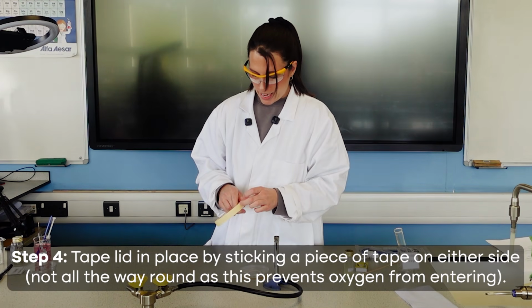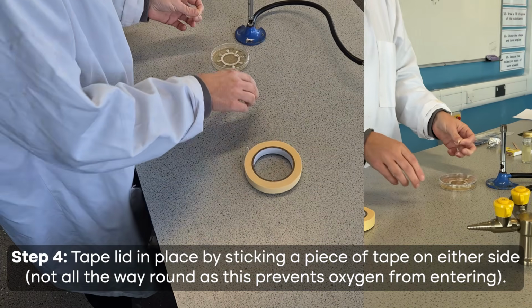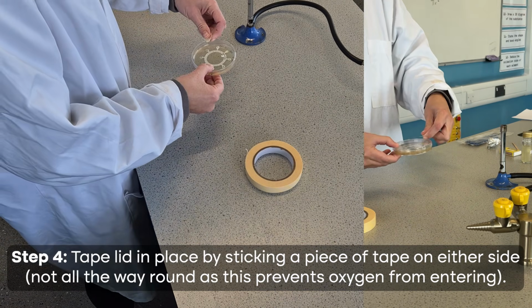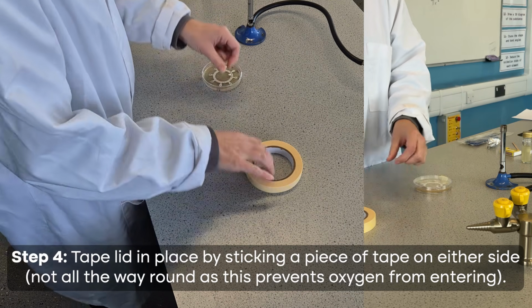Final step then is we will tape our lid down so it can't come off, but you need to make sure you are only putting a piece of tape on either side.